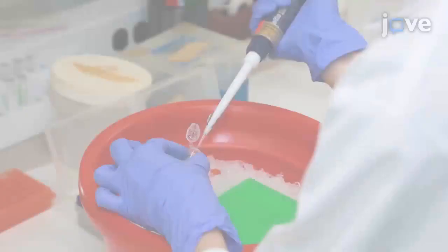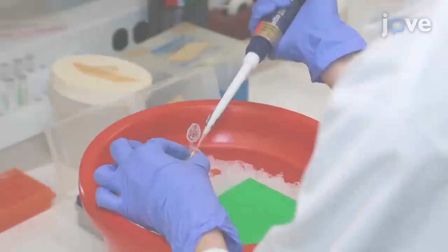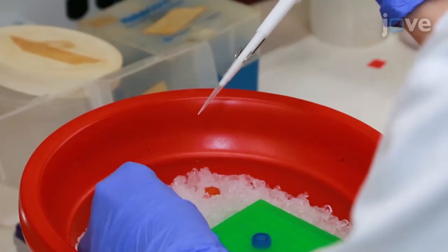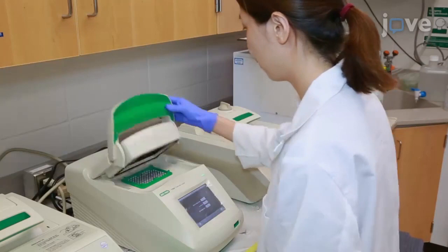To begin, mix 1 µL of GFP entry plasmid DNA with 5 µL of a commercially available C-term linear DNA in 250 µL PCR tubes. Next, add 2 µL of commercially available lambda recombination mix to each of the PCR tubes. Gently mix the tubes and incubate them at 25°C overnight.